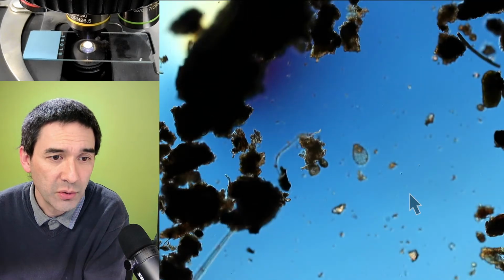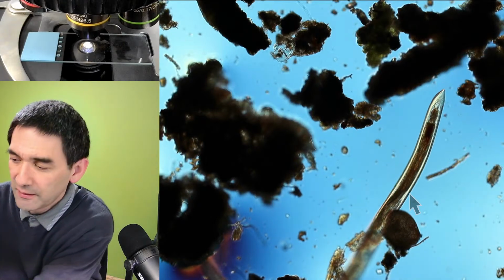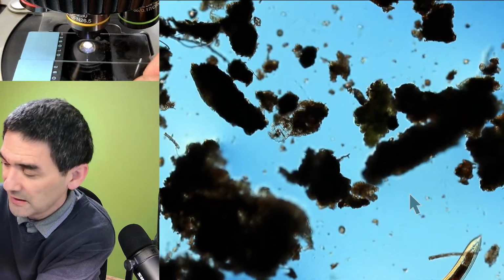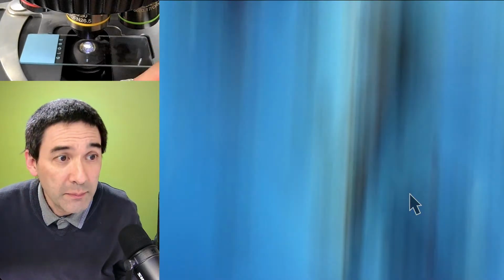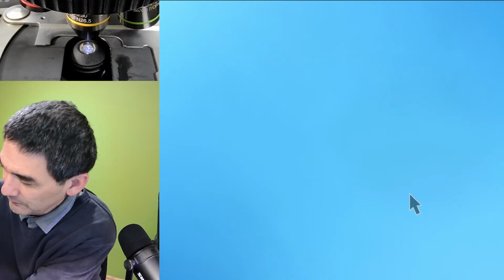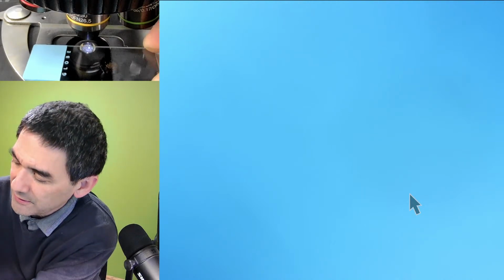The water bear has, I don't know, disappeared now. Here is the nematode worm from before again. Okay, so I'm going to now put on the slide. You can actually see me inserting the second slide here. The problem is that I spilled some water and now it starts to stick on the microscope stage, so I have to wipe it a bit here. You know what? I'll just remove the other one first. Okay, so at least, even if we're not lucky now, we've seen a tardigrade before.